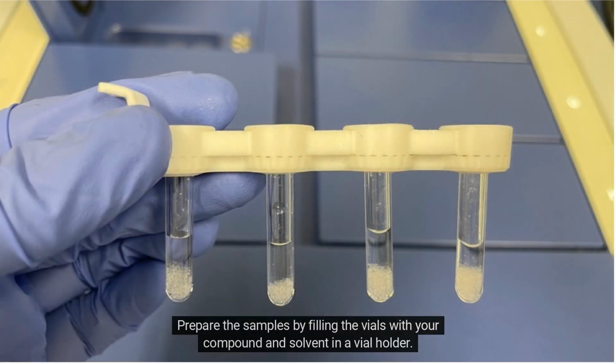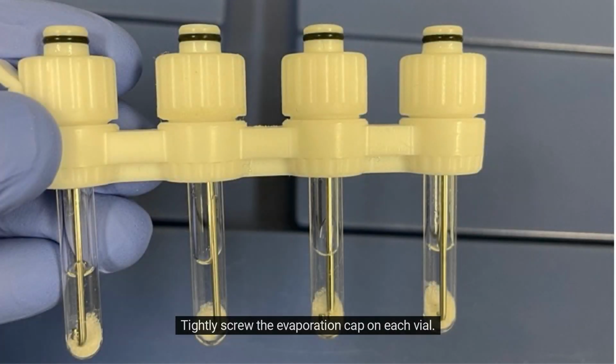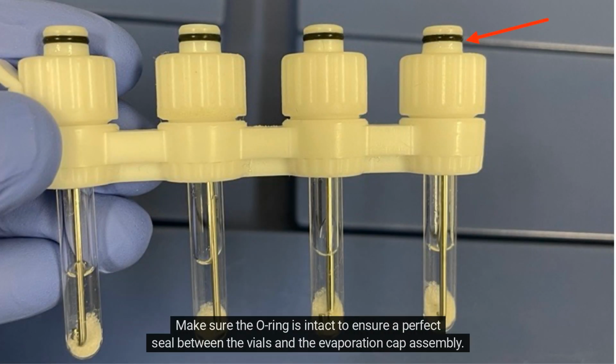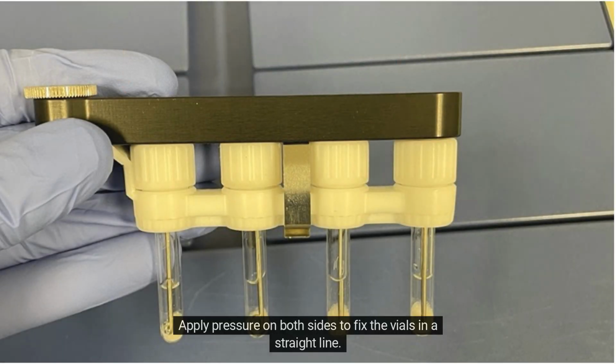Prepare the samples by filling the vials with your compound and solvent in a vial holder. Tightly screw the evaporation cap on each vial. Make sure the O-ring is intact to ensure a perfect seal between the vials and the evaporation cap assembly. Place the evaporation top assembly on the vials. Apply pressure on both sides to fix the vials in a straight line.